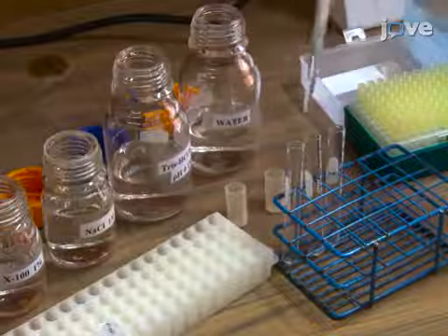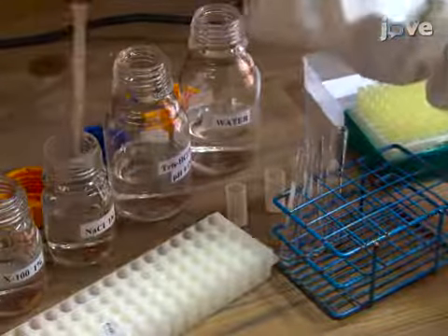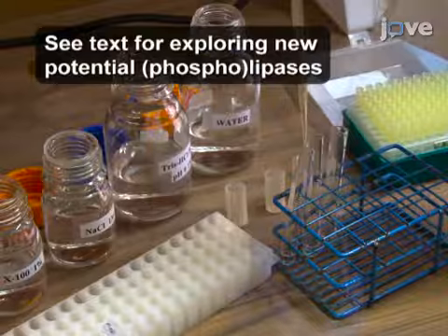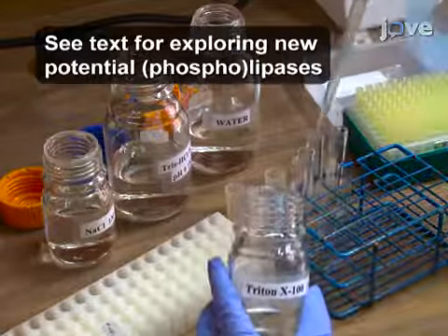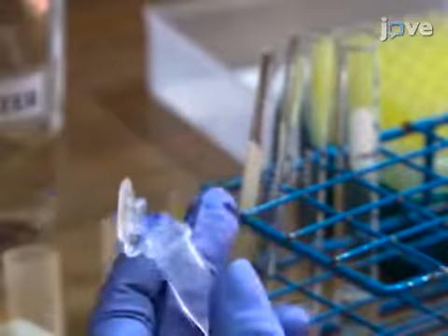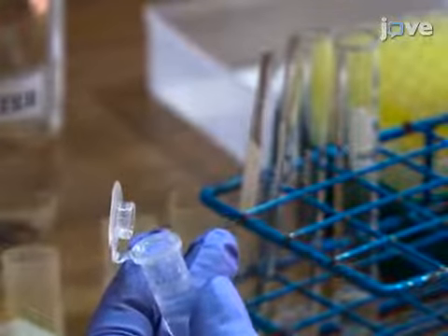Set up the previously optimized enzyme assay using the pipetting schemes tabulated in the text protocol. For an initial coverage of distinct enzyme activities, use artificial substrates that yield a colored product upon hydrolysis, such as para-nitrophenol or PNP derivatives.